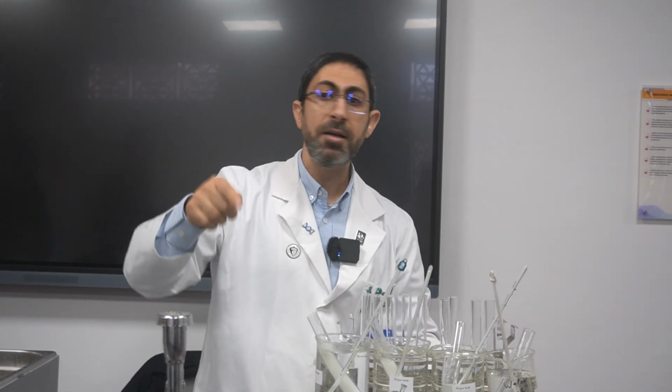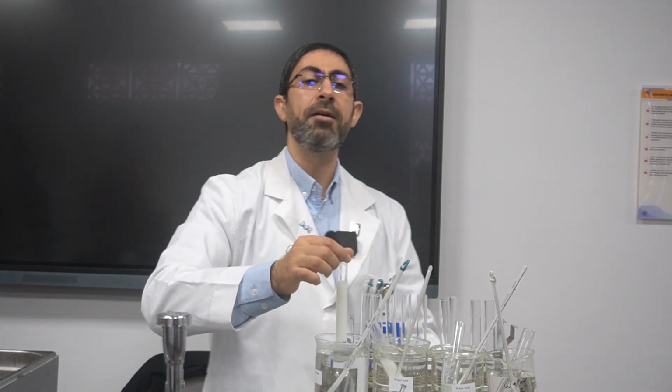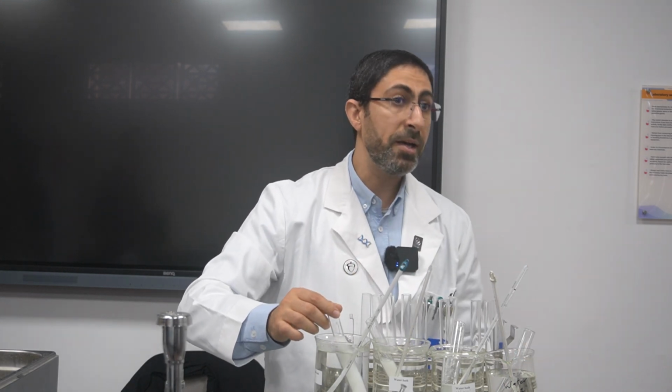Now it is your turn to do the same experiment and to record the results and plot a graph between the temperature and the time taken for the solution to become clearer. Okay, thank you. Take your time.